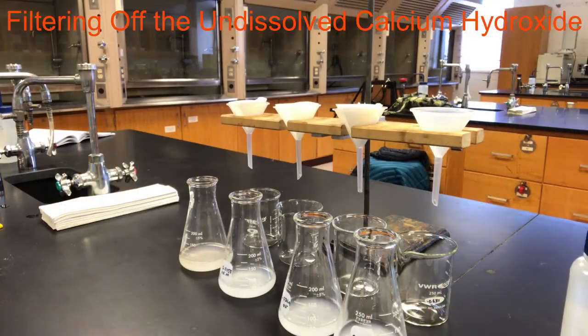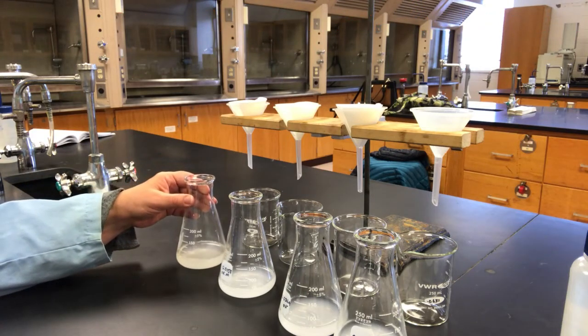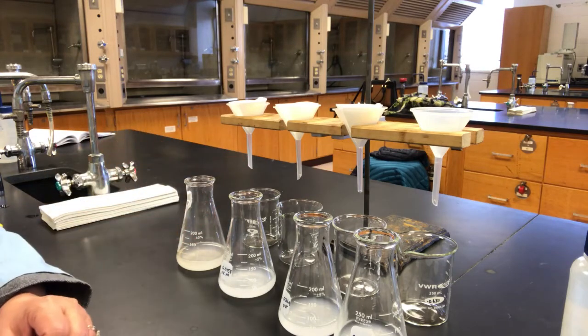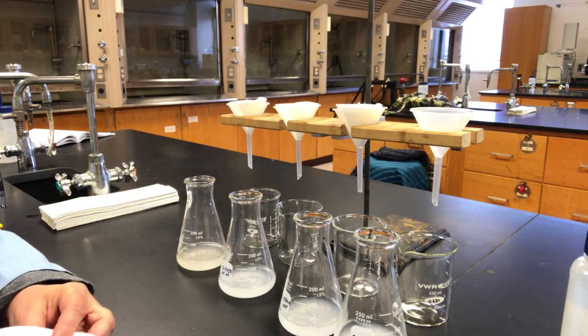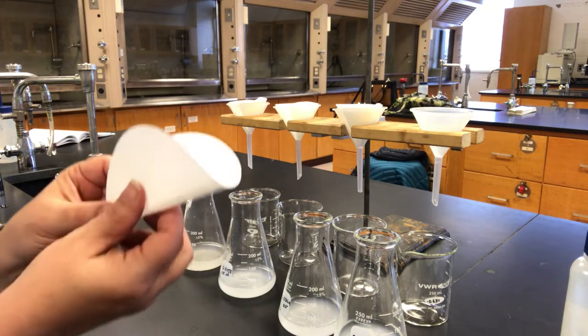I'm set up now to filter out the excess calcium hydroxide that didn't dissolve. You can see that it's cloudy here. So what we want to do is capture just the amount of hydroxide that is in the solution right now. I've set up a filtering station here to filter out the excess calcium hydroxide. I put my filter paper into 3 of them, and I'm going to show you how I've done that here.